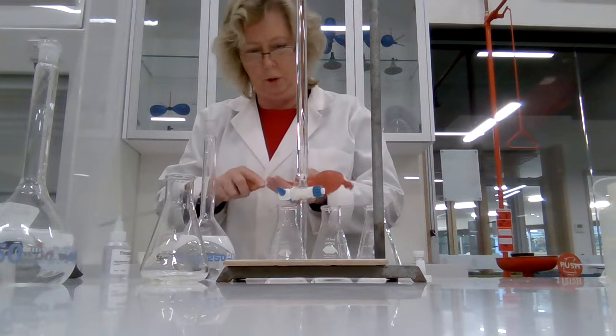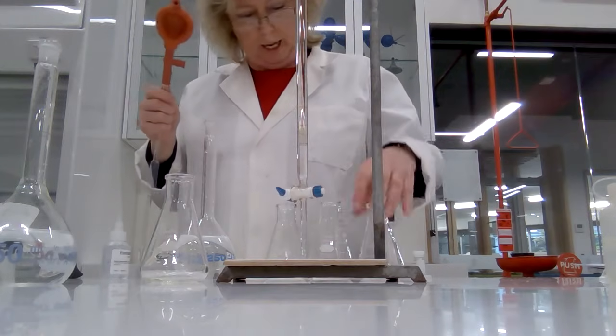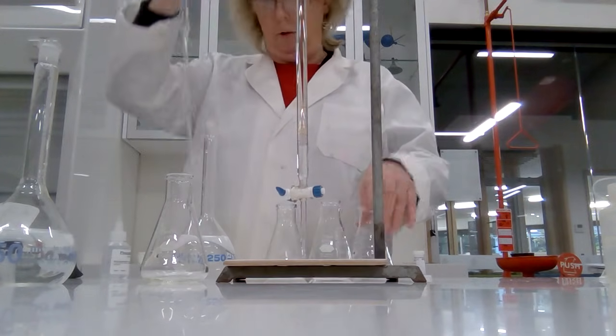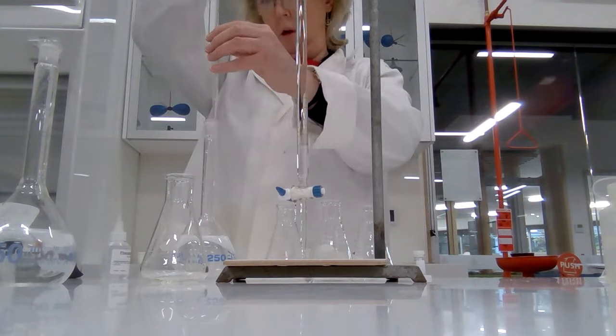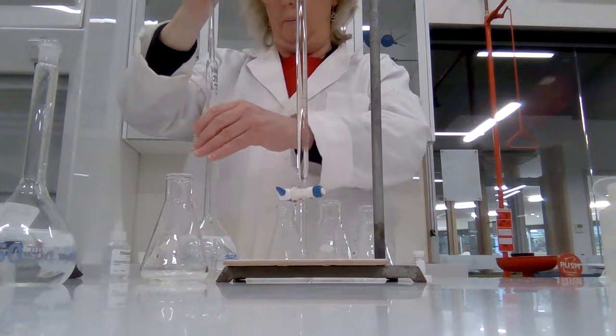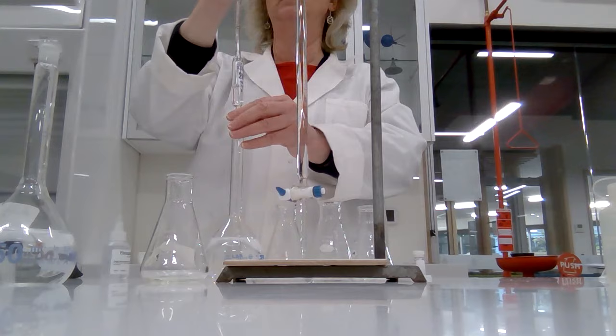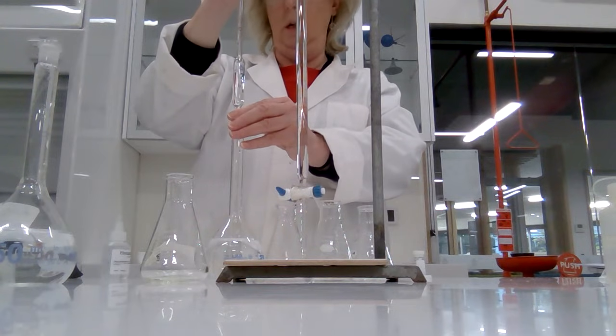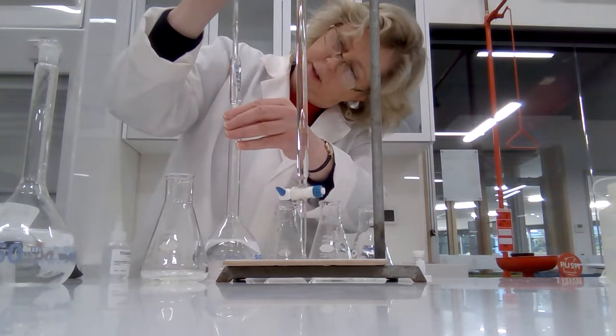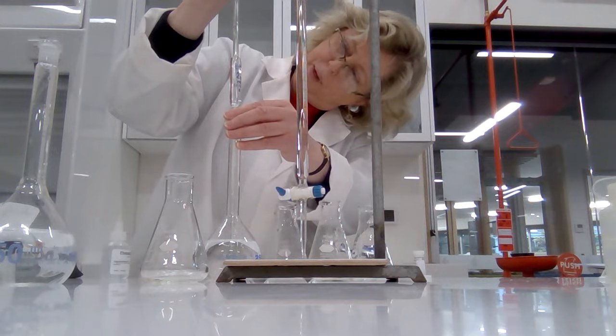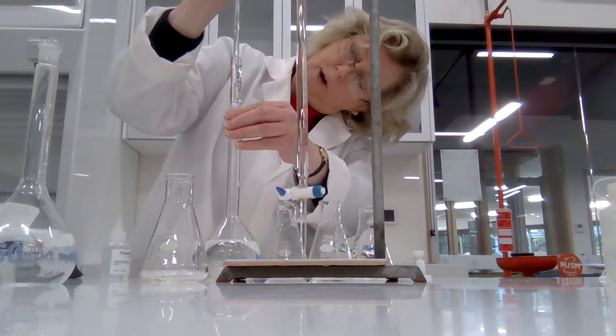So remember when you're filling a pipette, you use the button to fill and you go up to the line and you stop right on the line like that.